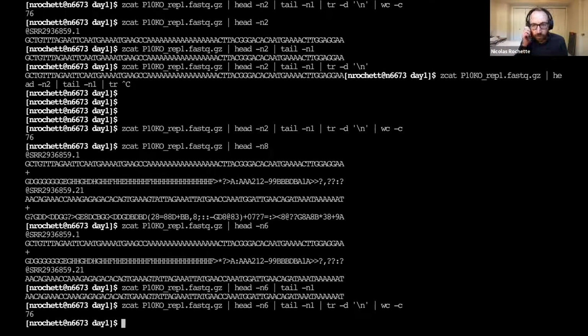But now we're just going to switch to bioinformatics software. In a lot of problems in bioinformatics, I think it's very important to understand what information is in the files, understand the file formats, so that we know what information we're actually dealing with, right? So here, a FASTQ file is just N reads with some sequences of some length, and then associated base qualities. But for most of the operations, we're actually going to have bioinformatics software do it for us.